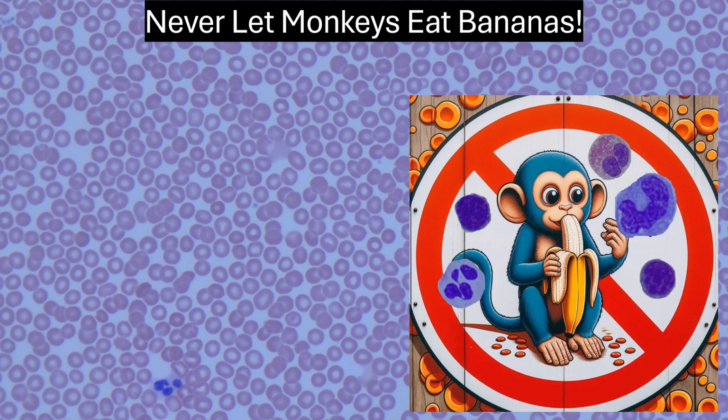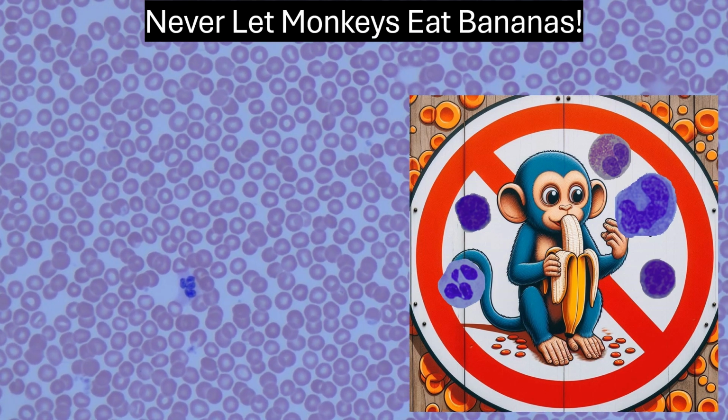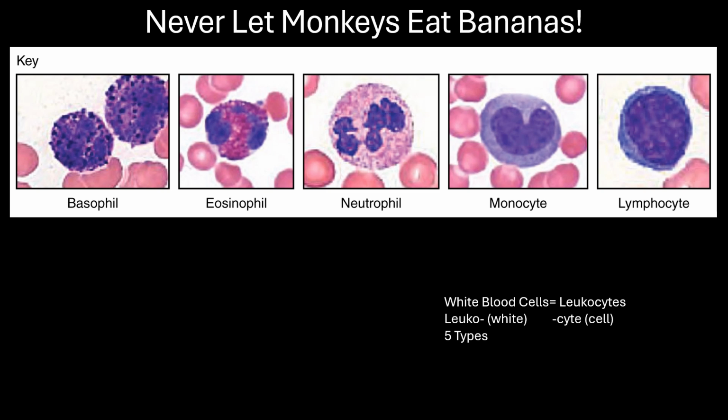Never let monkeys eat bananas. Why is that, and what does that have to do with blood? Find out what it means in tips and tricks in this video on how to identify white blood cells. If you want to skip ahead to the practice questions, the questions are timestamped below in the video description.